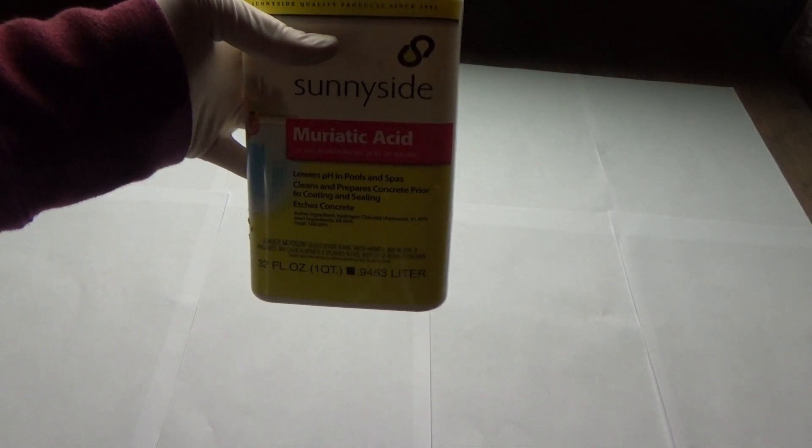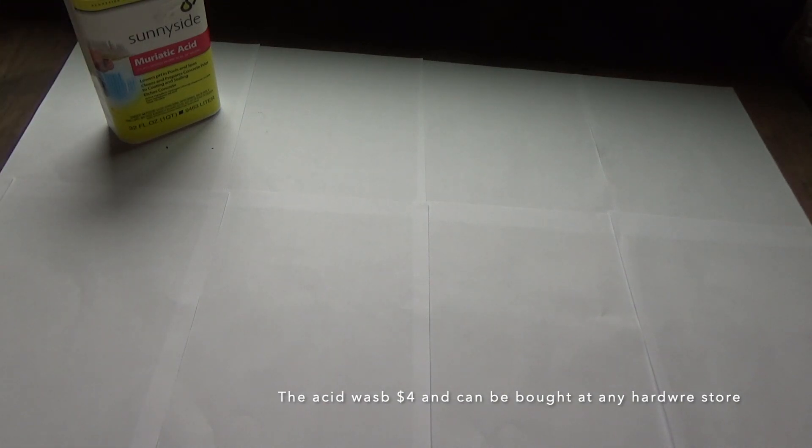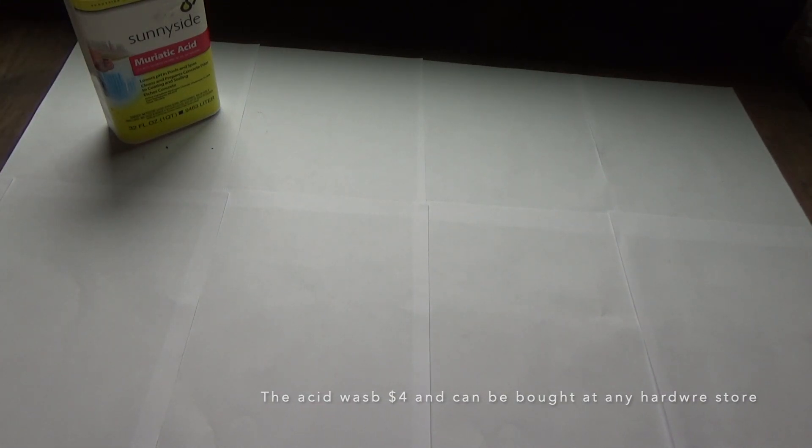For the ingredients, all you're really going to need is muriatic acid and some sort of metal.